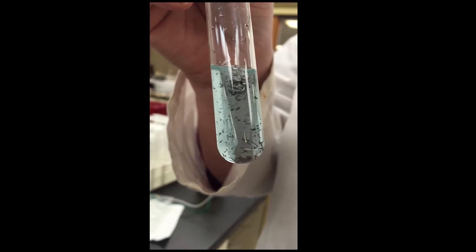I'm just going to shake it a bit, and you can see that newly formed copper becomes dislodged and it is kind of floating around in there. It will float on the bottom.